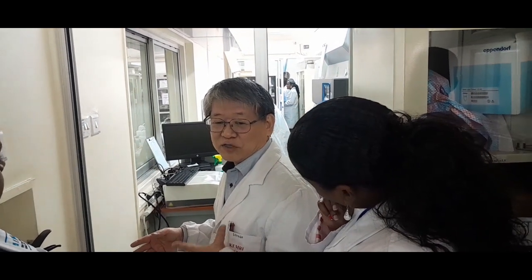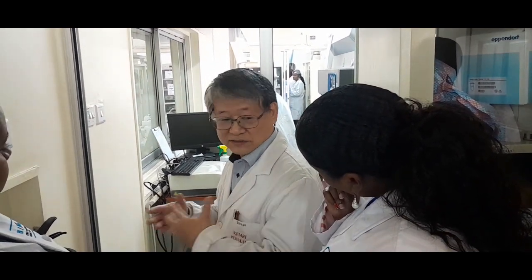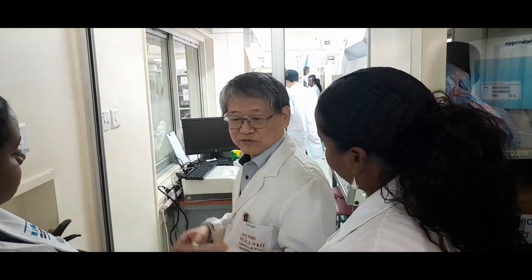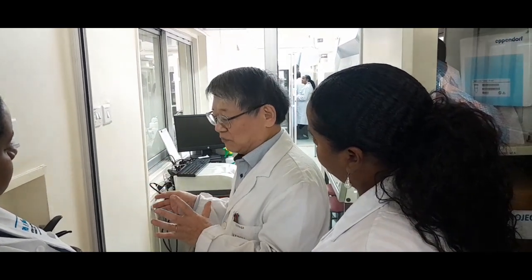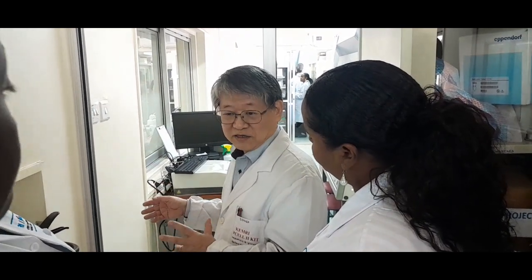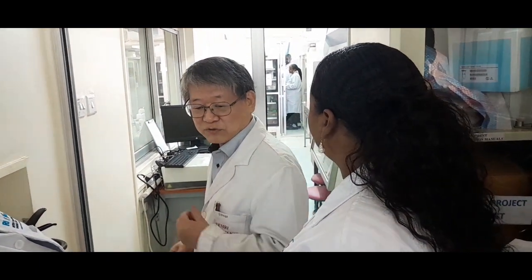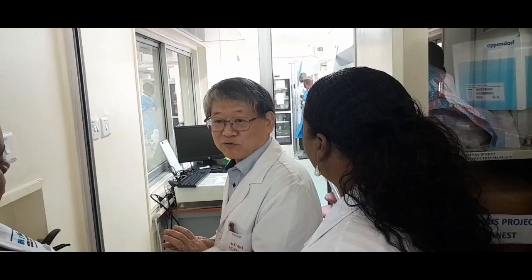We used to use the same P2 laboratory with our research group, but they want to put their own machine, or they want to keep the clean space by themselves. So in case we have such a request in future, we will provide it with charging, so that we can have income and then we can provide the clean laboratory.